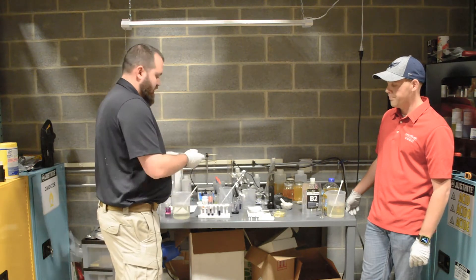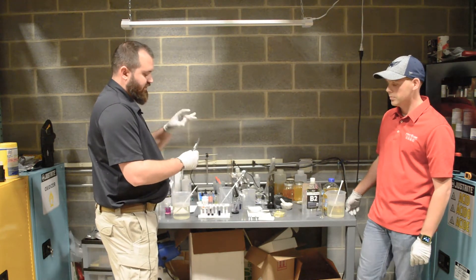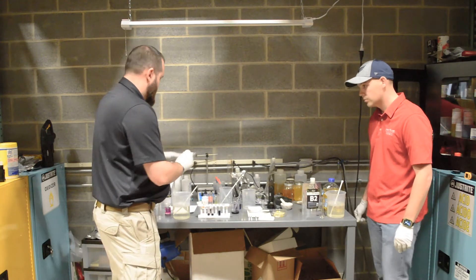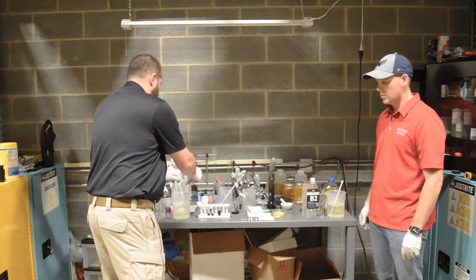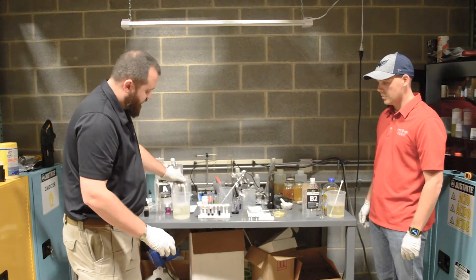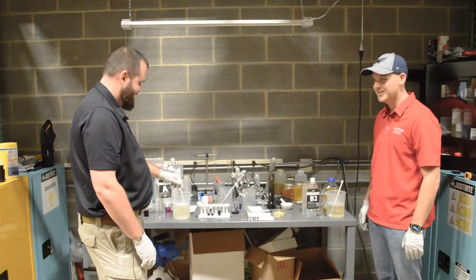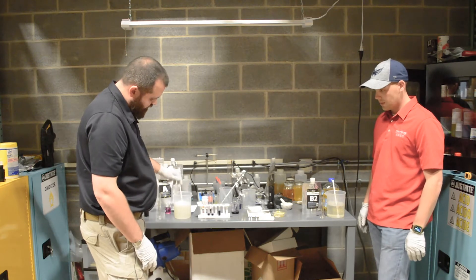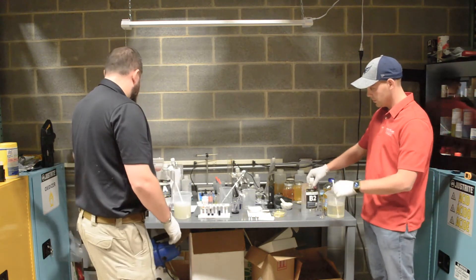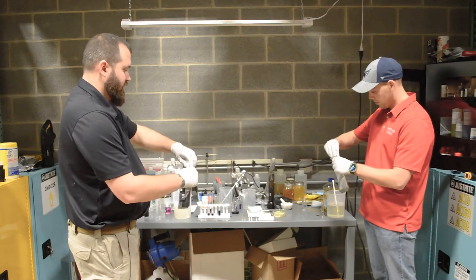So again this is the fresh Dahlgren. What I'm going to do is add the B1 and stir until it's completely dissolved. Now we've got the B1 mostly dissolved and we will both add the B2 at the same time.